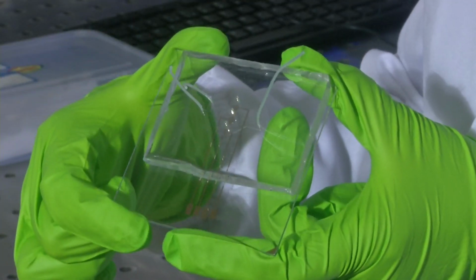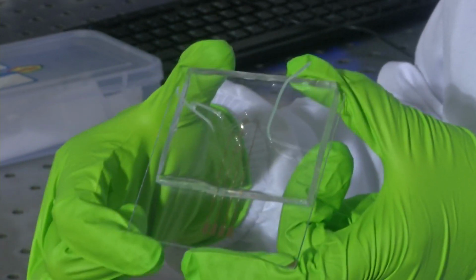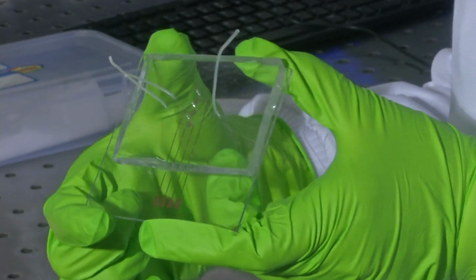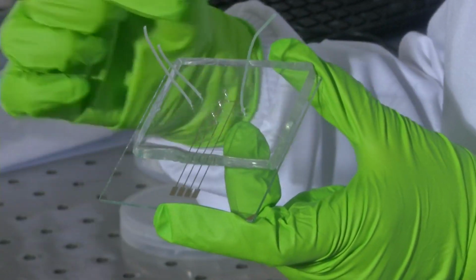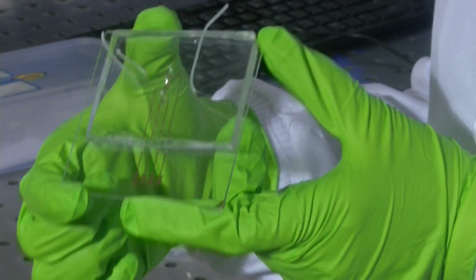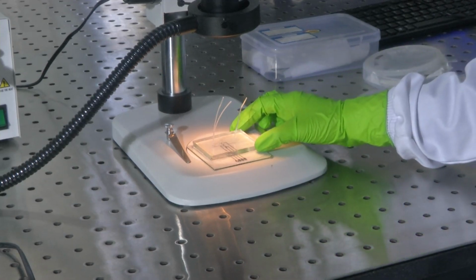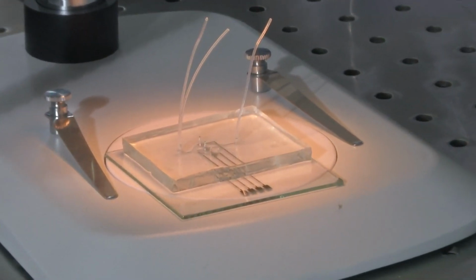Let us say you are trying to study if the features of this device have been obtained the way you have designed it. So, let us say I want to understand this device. Now this more or less is a 3D. You want to decipher what the depth is, what the features formed on this are. So, let us study how this looks under a stereo microscope. Now I have placed this device in the sample slot.